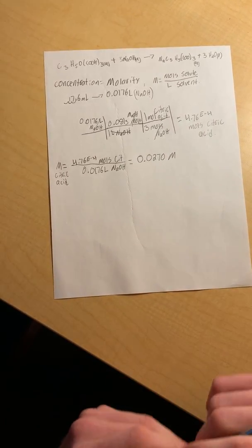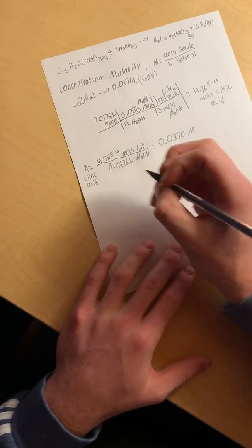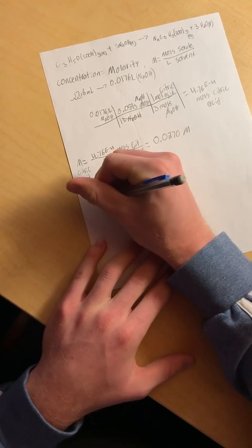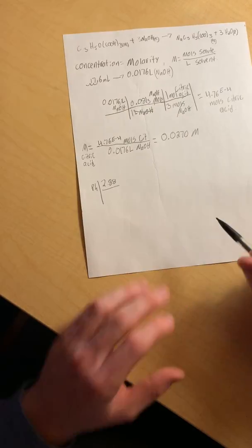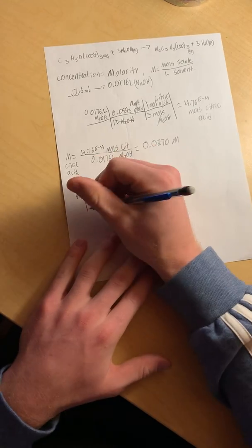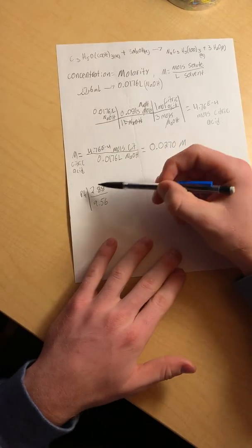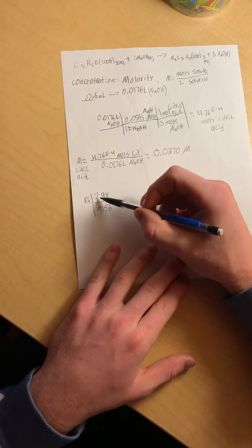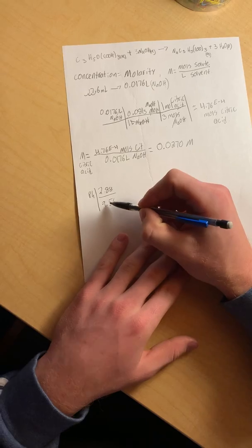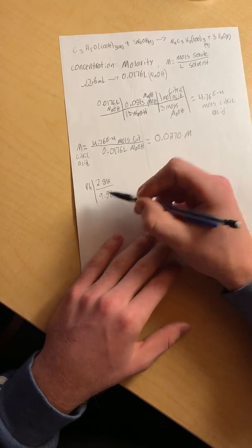The average pH before we did the titration of the lemon juice was 2.88 on the pH scale. The average pH after we completed the titration was 9.56 on the pH scale. As you can see, 2.88 is very acidic and 9.56 is a fairly highly basic value.